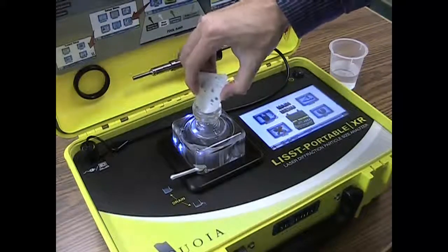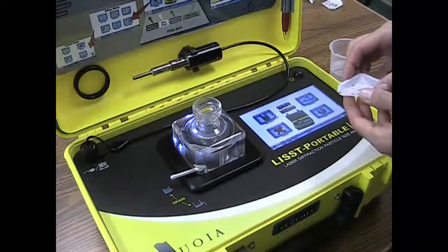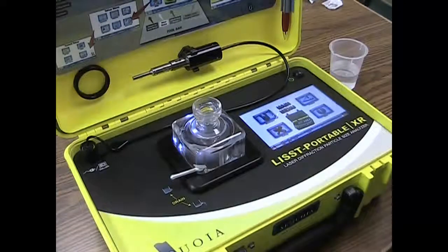Here, you may wish to rinse your mixing vessel with clean water to ensure all particles are transferred to the mixing chamber.